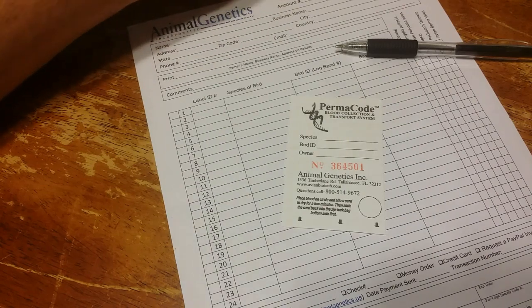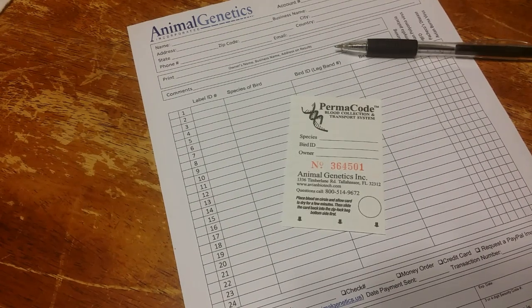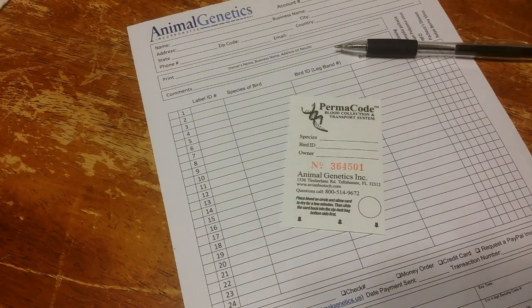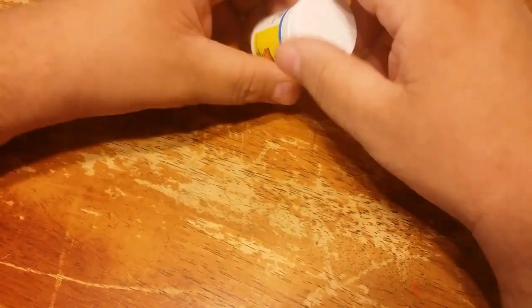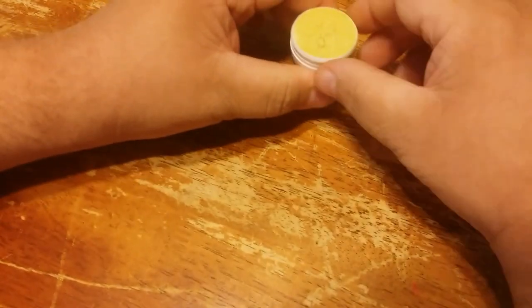We're going to trim the bird's nail until it bleeds. I know that sounds awful, but you take your children to the doctor for vaccinations and your dog to the veterinarian for its shot. The nail clippers are clean and have been sanitized. I'm going to get out some of this powder and just dump some out onto the table so that it is readily available, quick and easy.